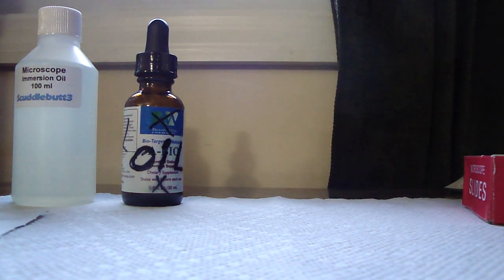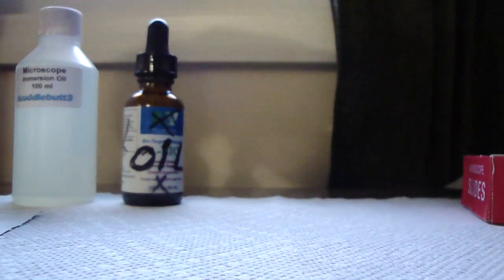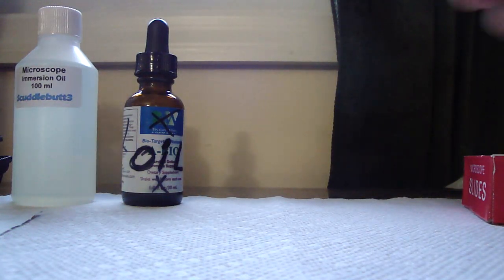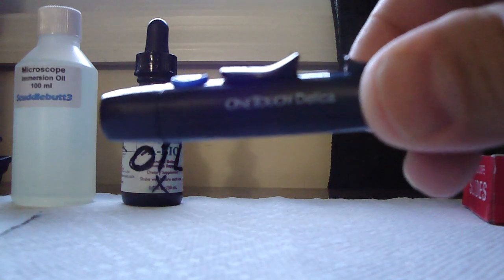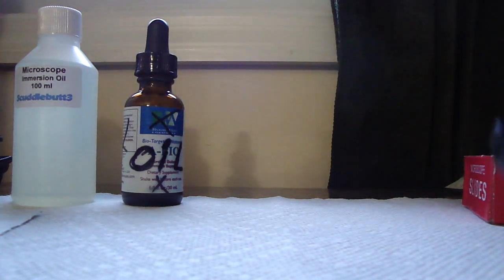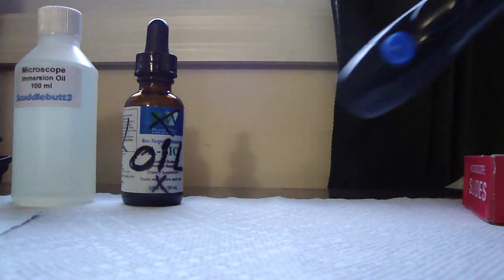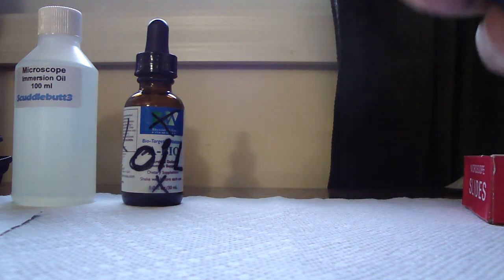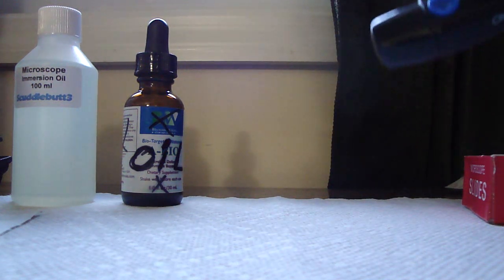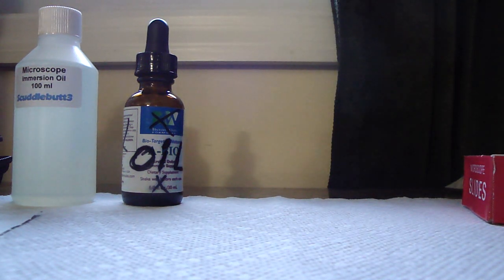That would be a second approach to see those spirochetes specifically. So what I'm using here today is a diabetes test kit. I don't use the portion that tests the blood glucose. Instead, I use the automatic lancing device. It's the One-Touch Delica, and there's a little lancing device in there. There's a thumb wheel on one side, and it allows you to adjust the amount the needle pinches your flesh.